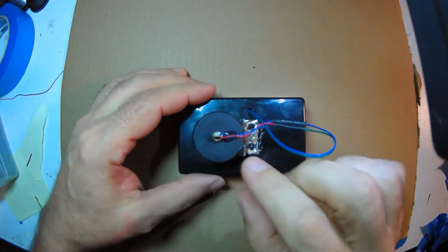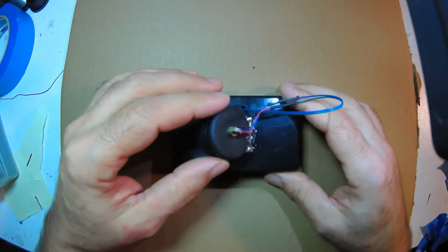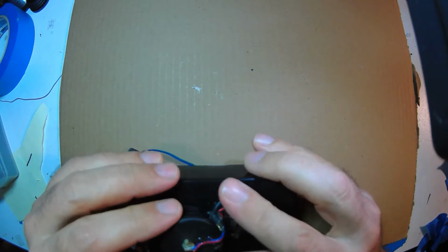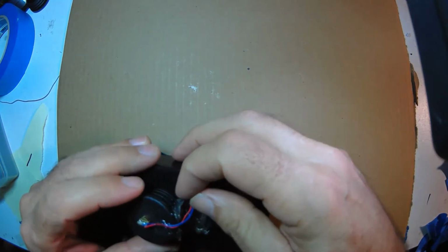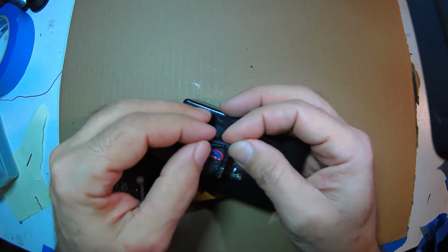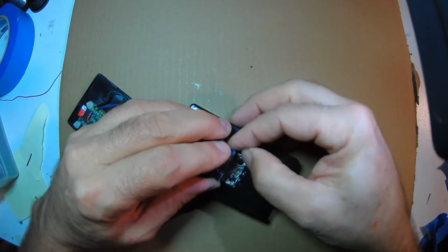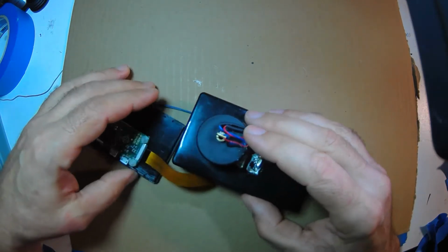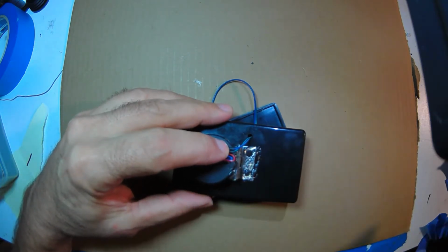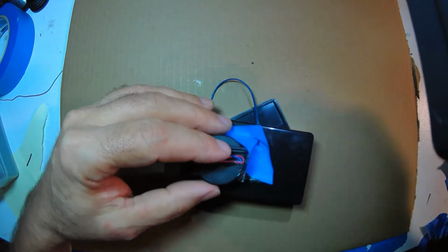The final step, we glued this in place, so we have this working. Okay, and so now we just have to tuck in the wire. And we want to kind of lay this down so it's not stressed. The wire they give you is kind of flimsy, so I'm thinking I can anchor this here, and then I have the thick wire, which will go down the front. Okay, so let's do that in steps. I'm going to anchor this all on the head like that. So my trusty tape will hold this in place, and I'm going to do it with my tweezers.